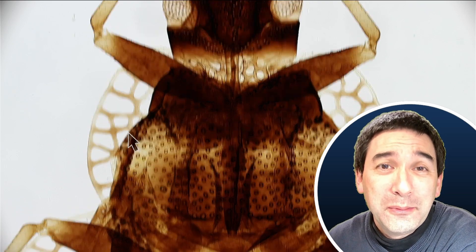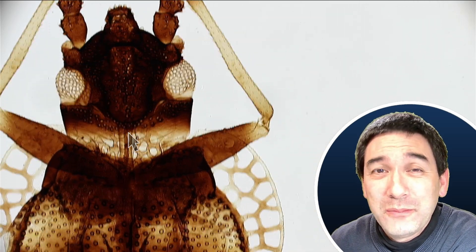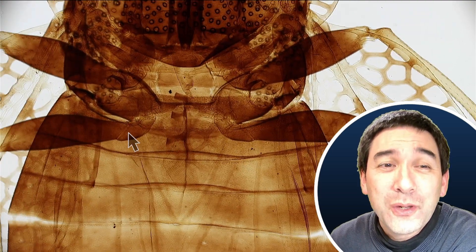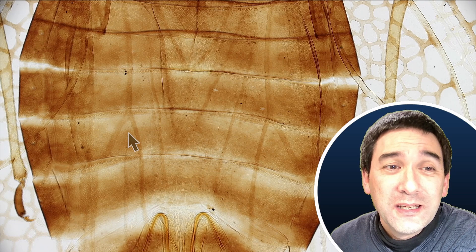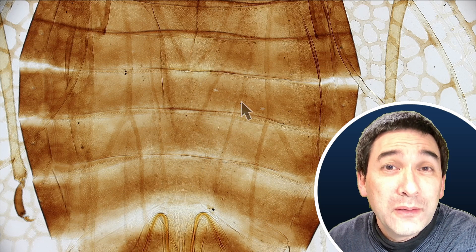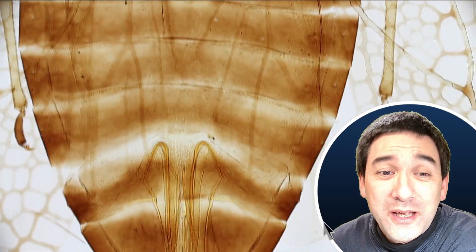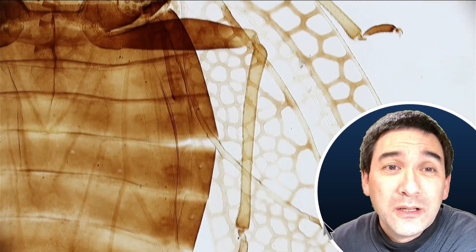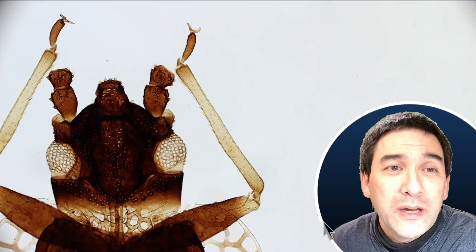Maybe some of you are able to give this little insect a name. But as I've already shown you in my previous slides, those antique slides are really well prepared — because whoever made this preparation put a lot of time and love into it. Look at this: the exoskeleton, which is the outside of the insect, looks transparent, so apparently it has been bleached. The inner organs have been removed, everything has been properly pressed flat so that we're able to see all of the details. Everything is quite nicely arranged as well — even the position of the legs — so that we're able to see all of the parts.